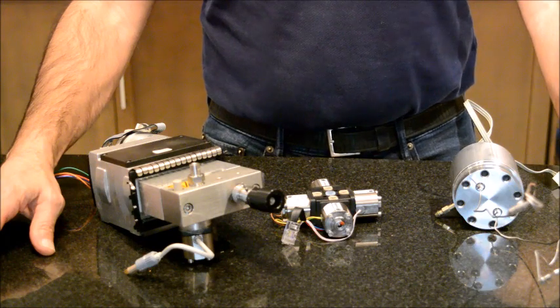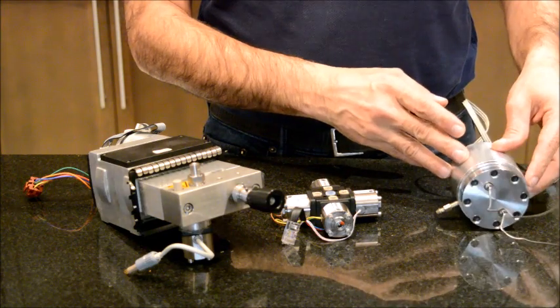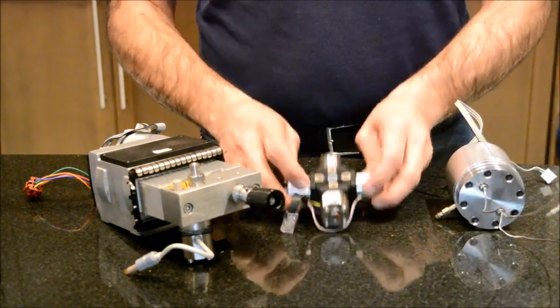Today I'm going to talk about two other components of Agilent HPLC pump: one of them is the flow damper and the second one is a gradient proportion valve.